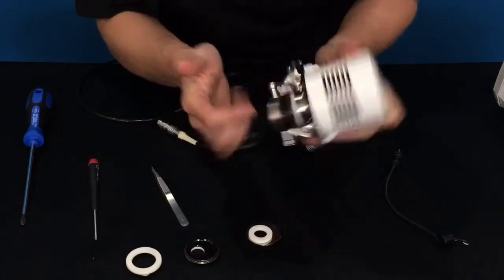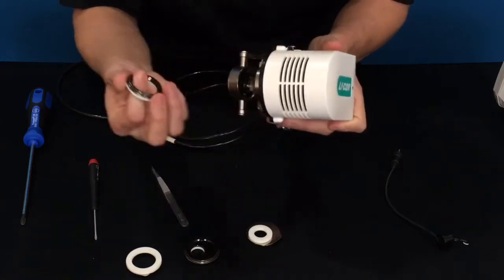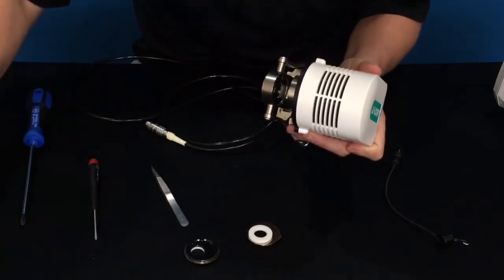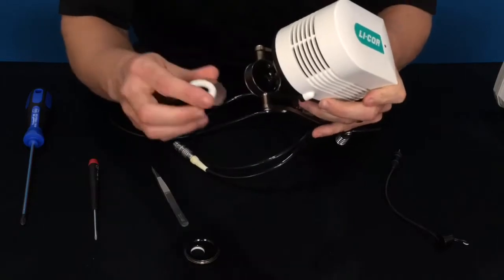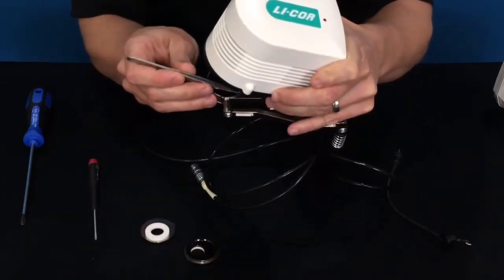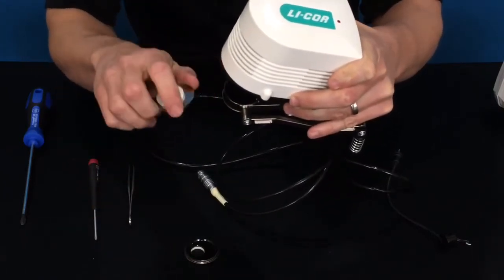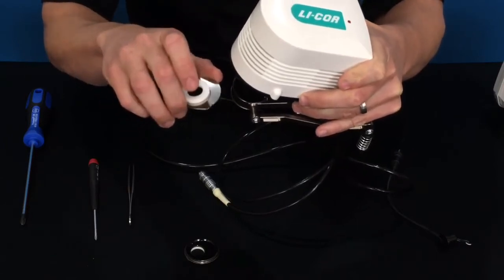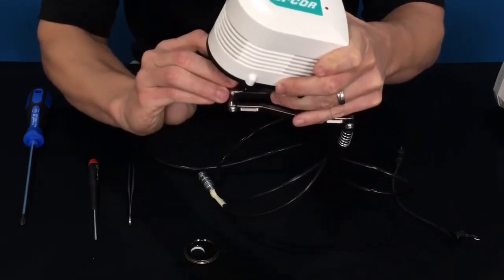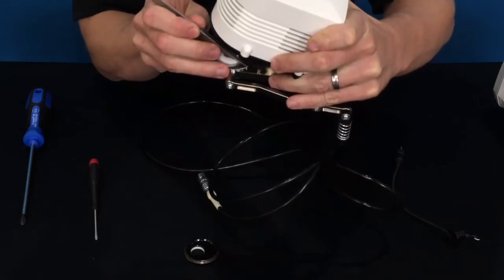You want to be careful, especially on the top — you don't want your finger or any objects to hit any of the optical components or the glass above. You can get underneath the aperture and pull it right off. Now, to install it, there's only one way. It is keyed and can only be installed in one direction. There is a small notch on the chamber that has to align with the matching notch on the aperture itself. Make sure that is lined up, then push evenly down, and you'll see the o-ring go into place. You'll know it's installed properly when the notch lines up.